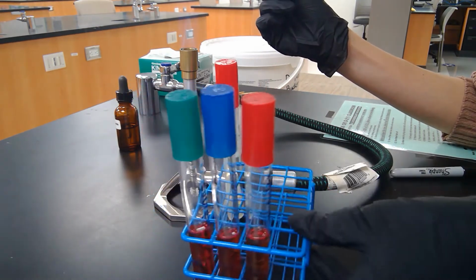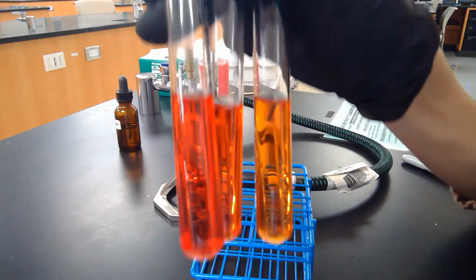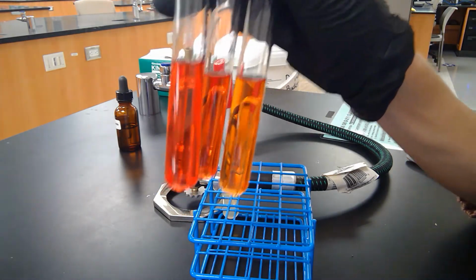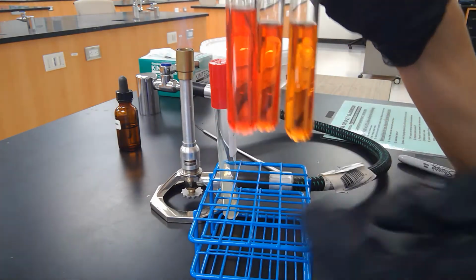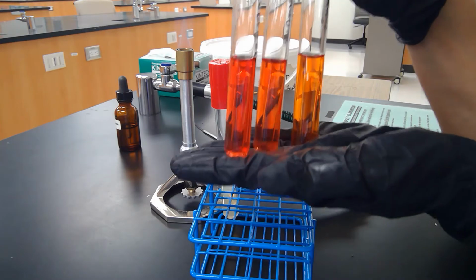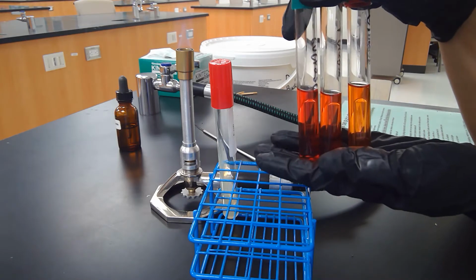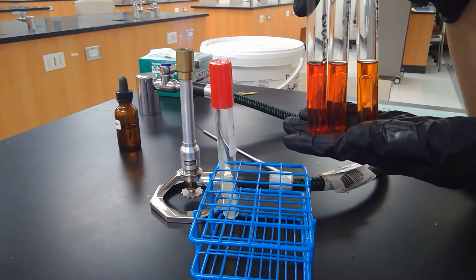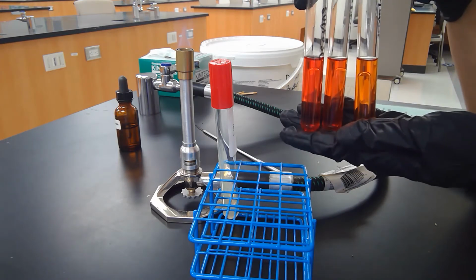So you can see now before the incubation, these tubes are at the normal, neutral pH, kind of red or sometimes orange. So you always want to keep one uninoculated tube so that we can see the difference in that color after incubation of about 24 hours. So I'm going to put these along with the other two sets of 3 for Pseudomonas and Staphylococcus epidermidis. And we're going to put this in the incubator for 24 hours, and then we will interpret the results.